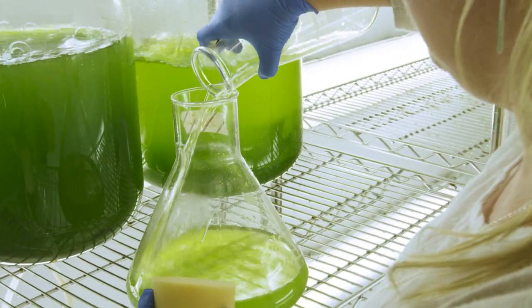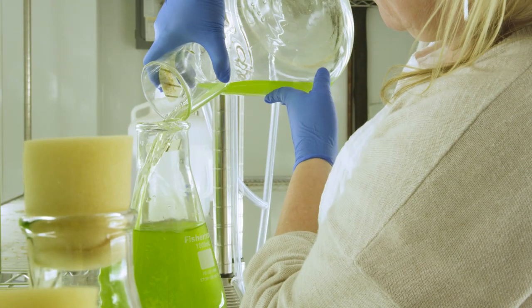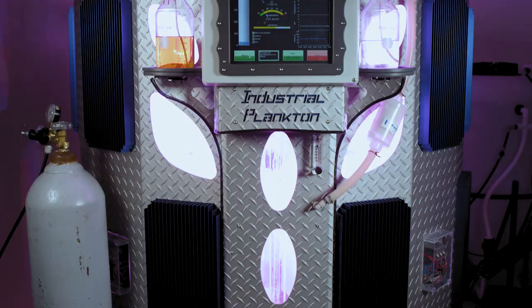The principles are the same whether you are working with 50 milliliter tubes, 20 liter carboys, or the 1250 liter PBR.